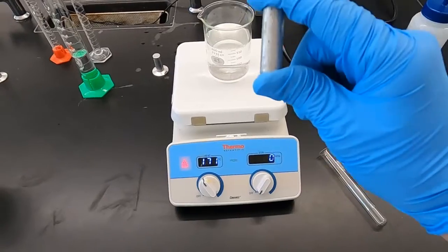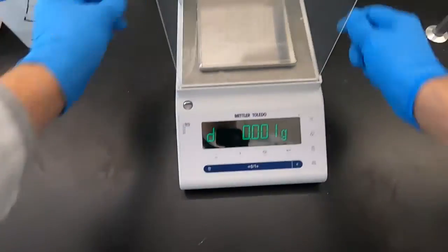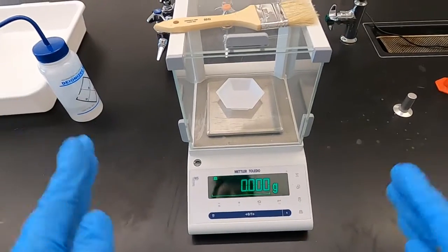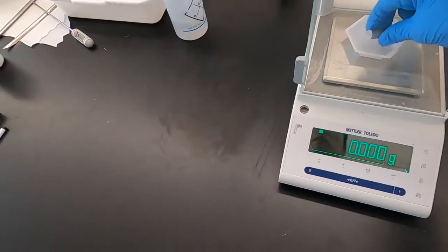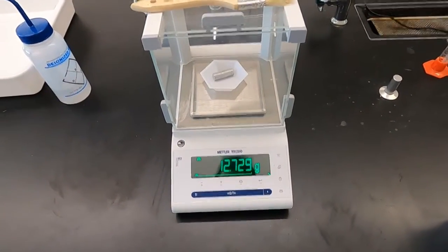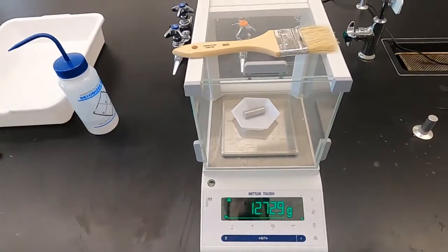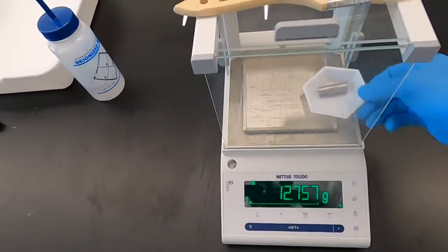So here is our metal. Let's get this on the scale. So here we have our balance. I'm going to put this, just make sure it doesn't pick up any contaminants, and I'm going to zero our scale, make sure we are getting a precise measurement on this piece of metal. So once it's at 0, place it on the scale. And so you can write down 12.729 grams as the mass of our metal. And we will keep that in mind as we prepare.